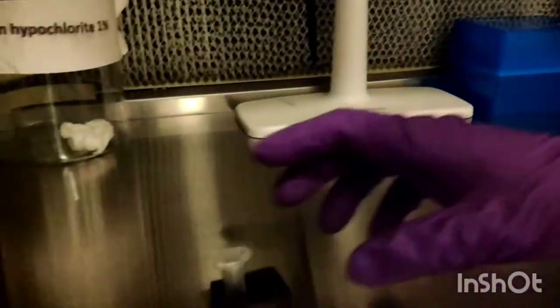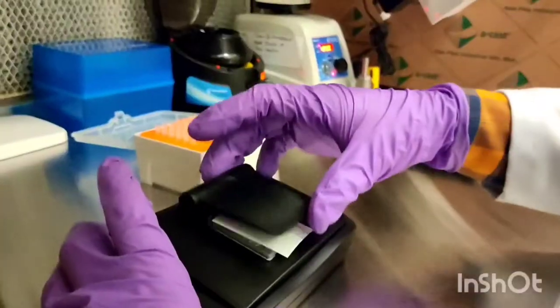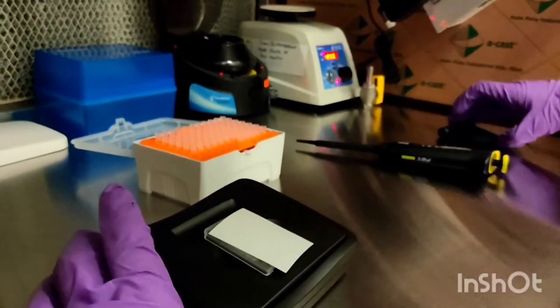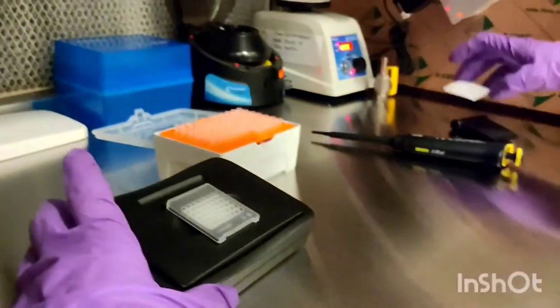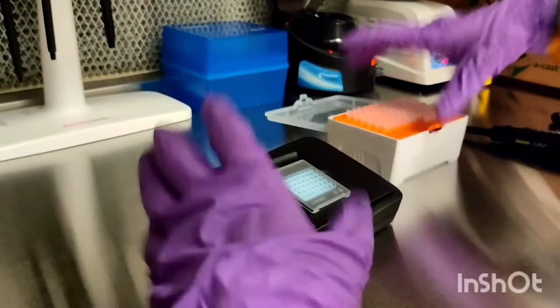And now we will load the PCR plate with the prepared master mix. This is the PCR plate with the plate holder.